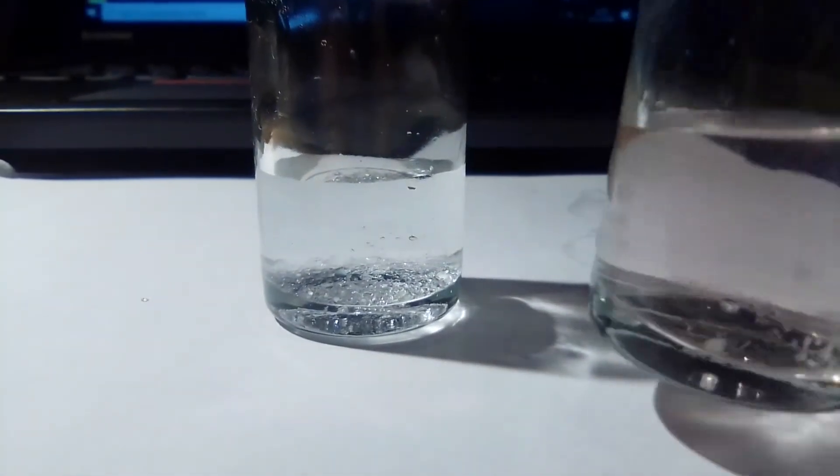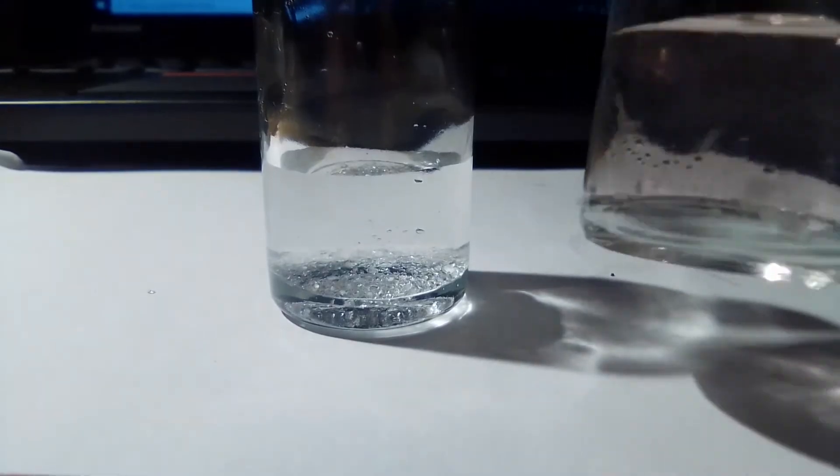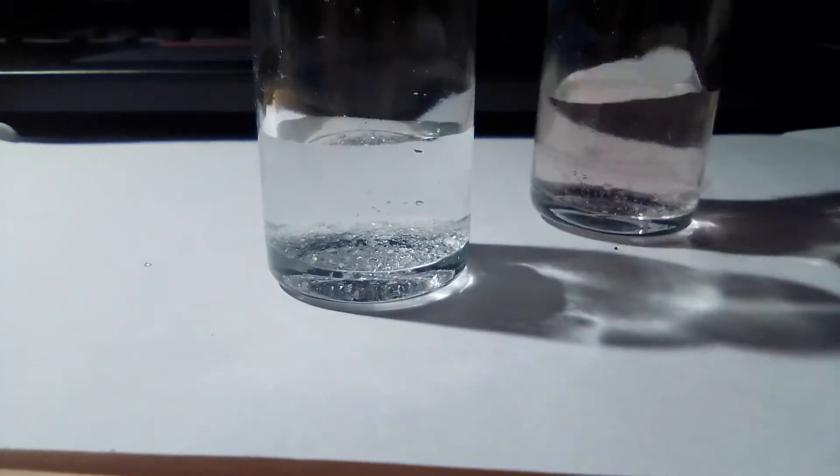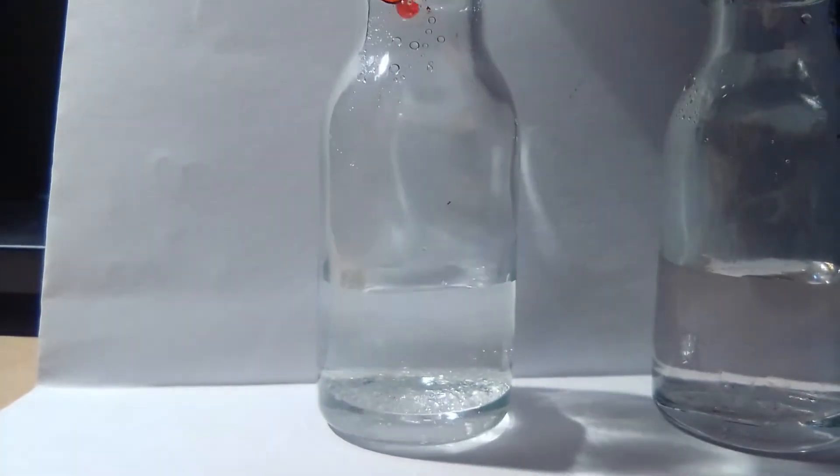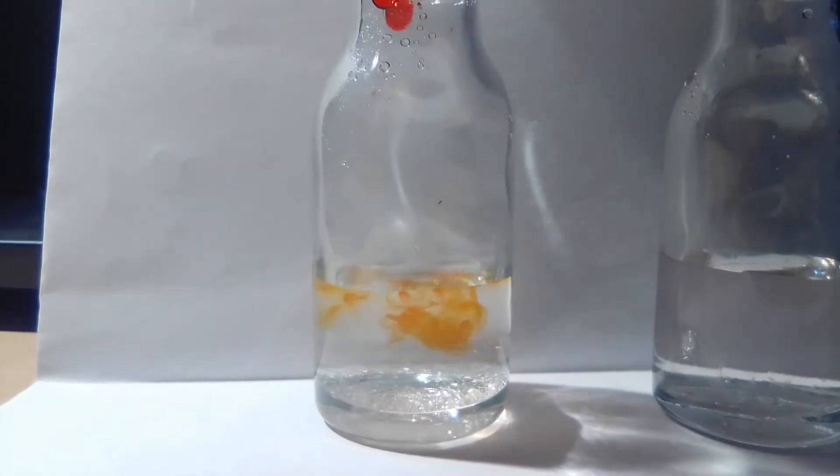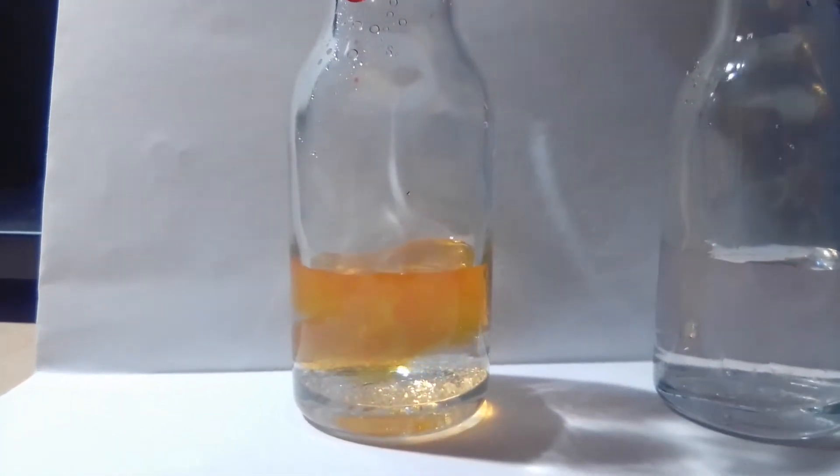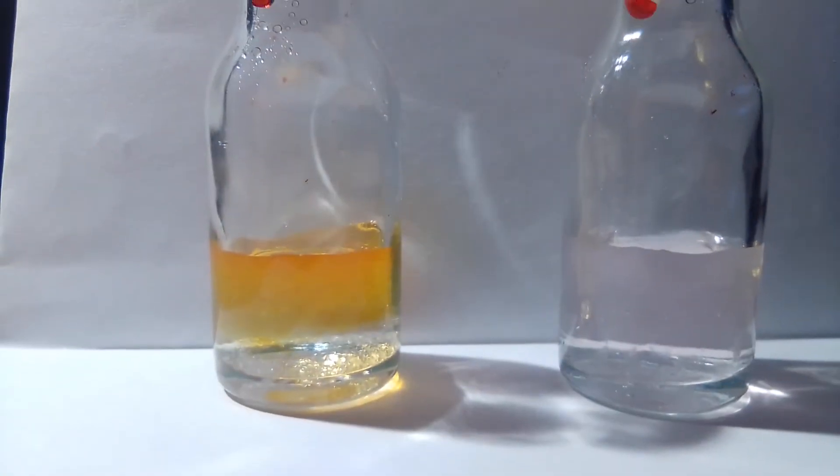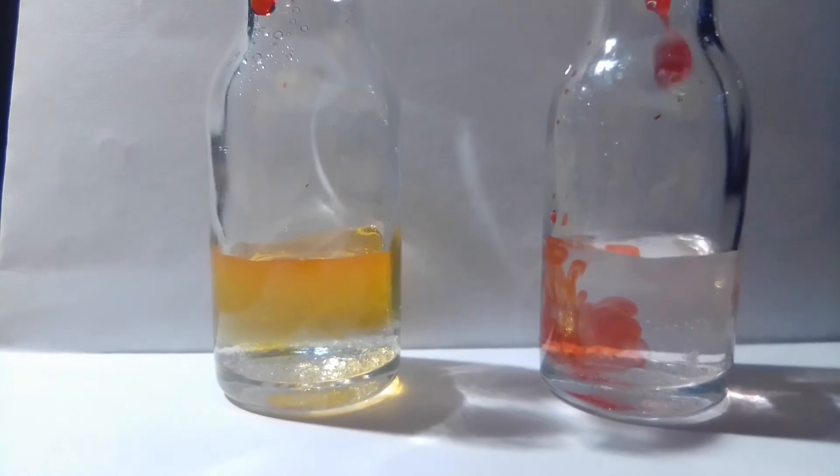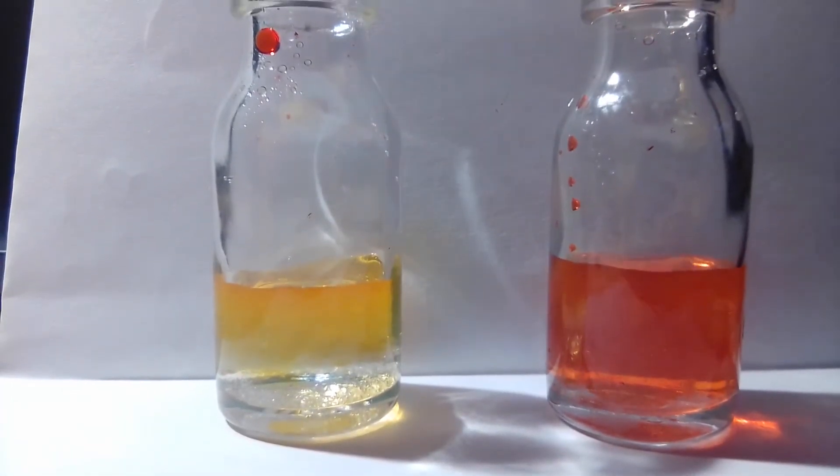Here is a basic solution of sodium hydroxide, it is a little bit pink because there is some dye left from the previous time. And there is some citric acid, so let's go first with the acidic solution. As you can see, aurin quickly changes from pink to yellow or orange, and here it remains pink.